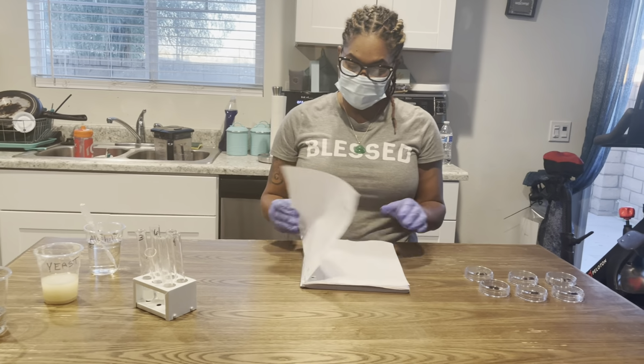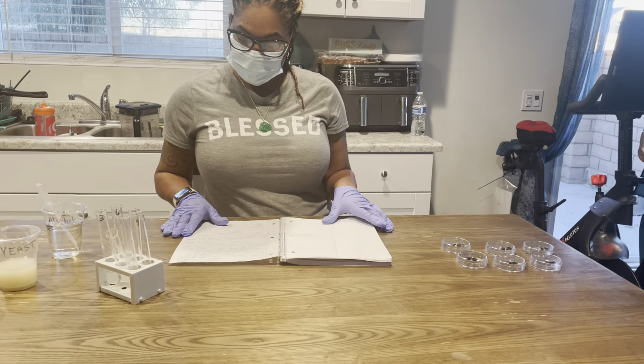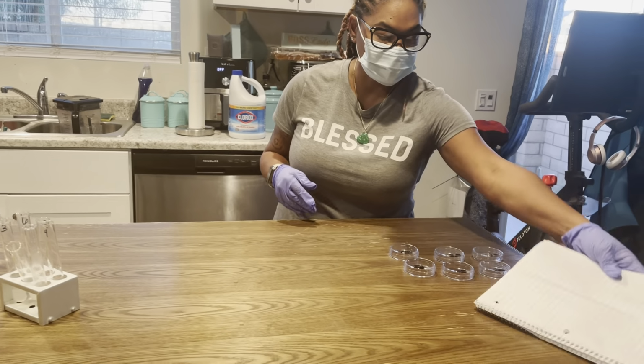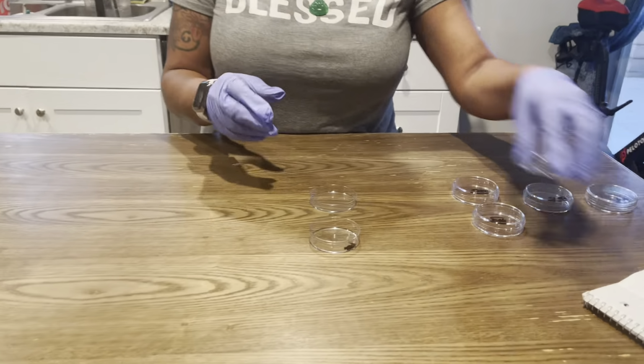And I am going to come over to my Petri dishes. Okay, this is 1, so I'm going to open these.